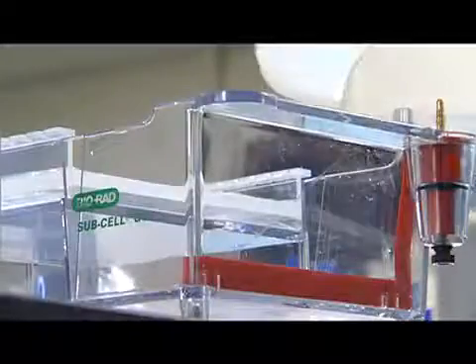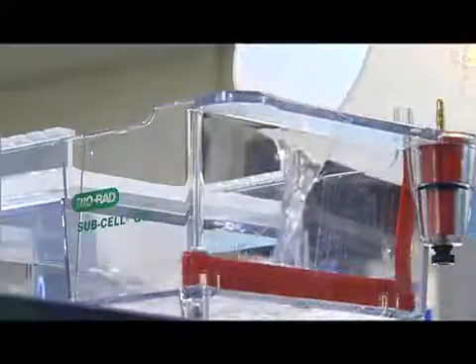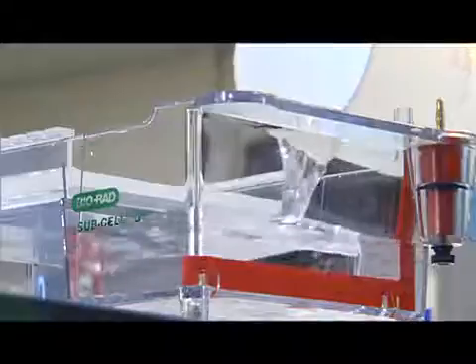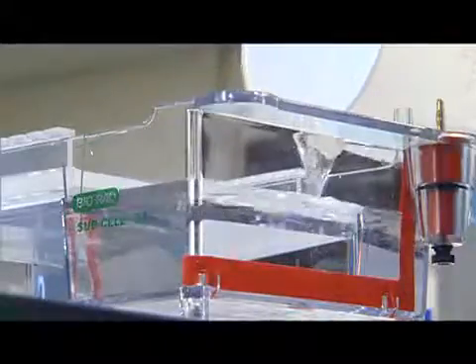Add buffer solution to the reservoirs at each end of the gel tank. Keep adding buffer until the liquid is about 2mm above the surface of the wells in the gel. This will make the gel easier to load and ensure the appropriate current runs through the gel.